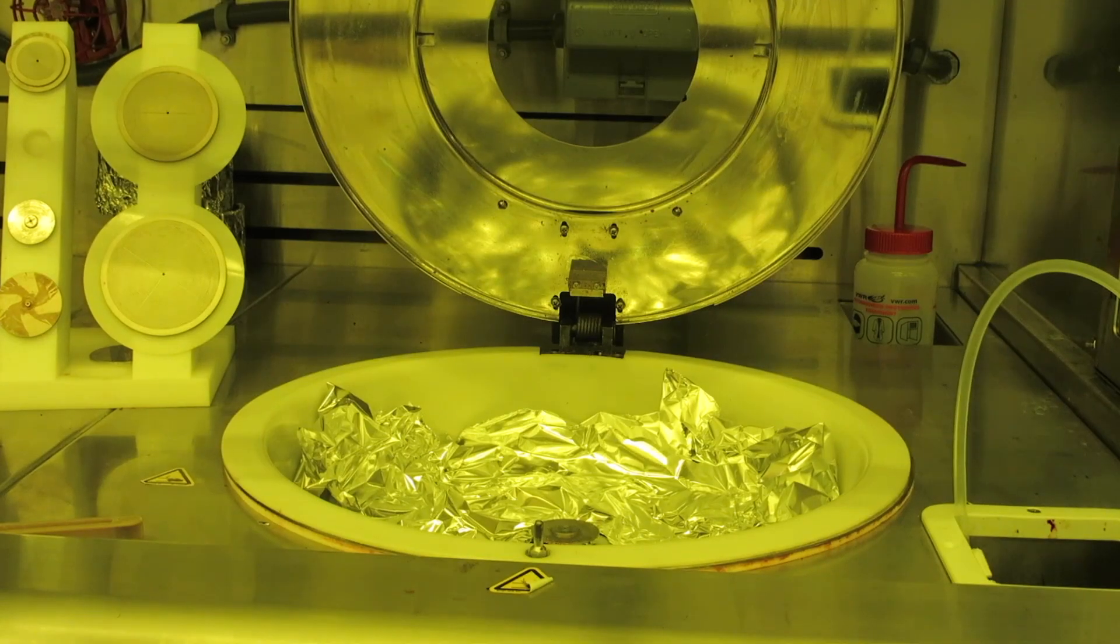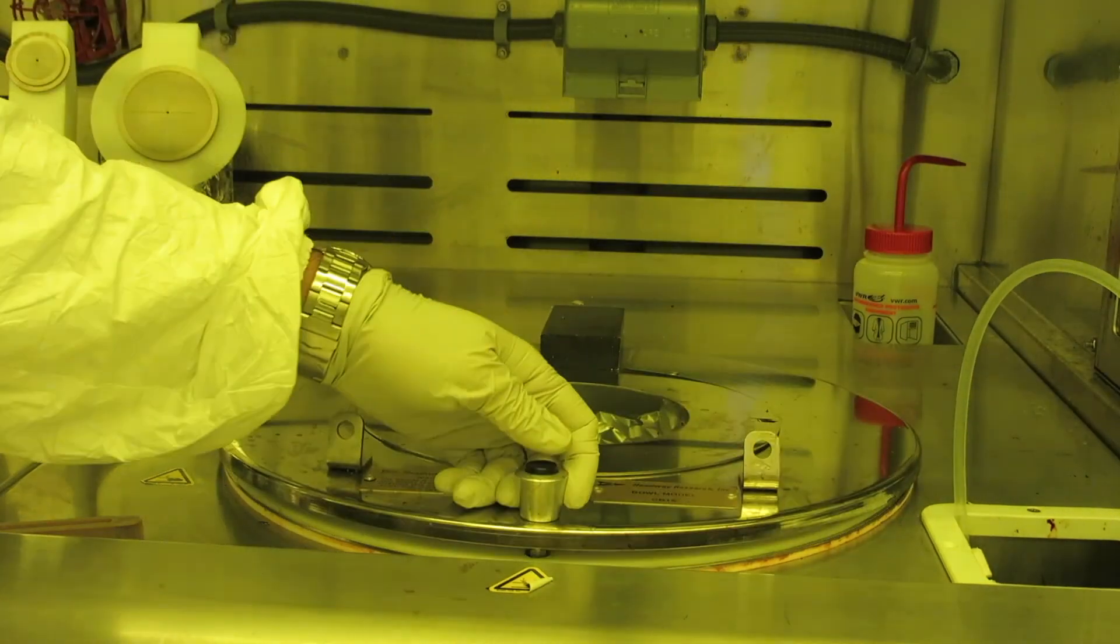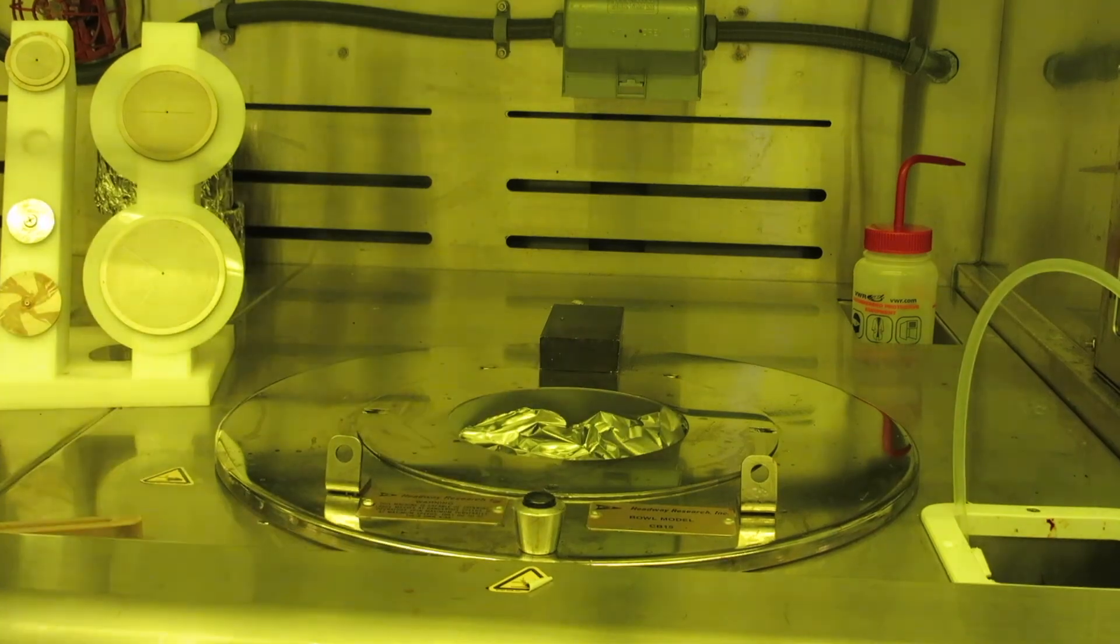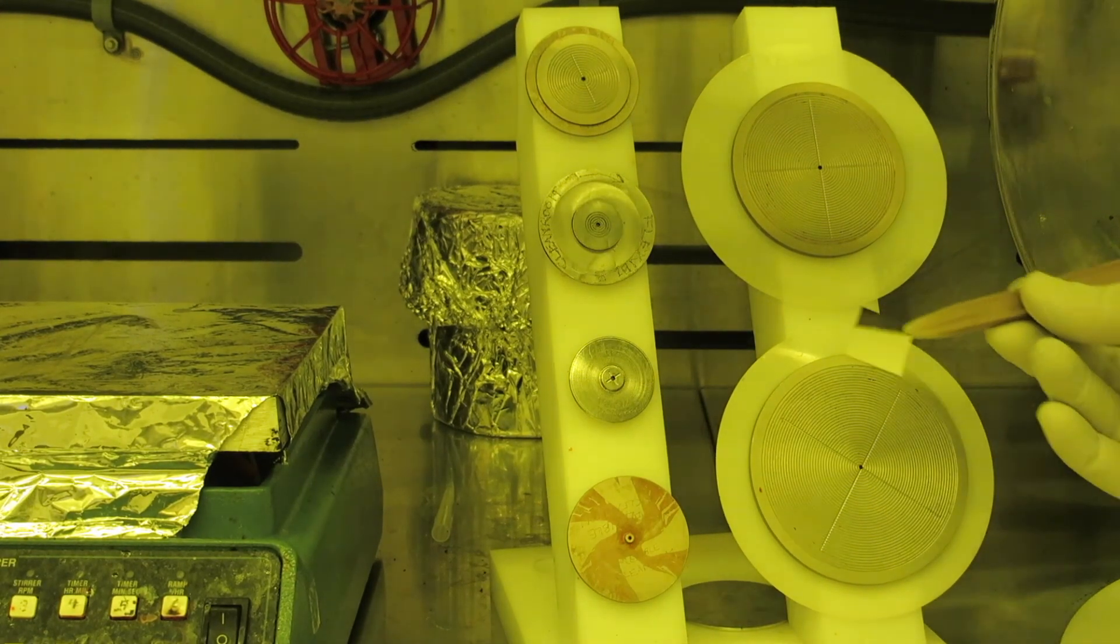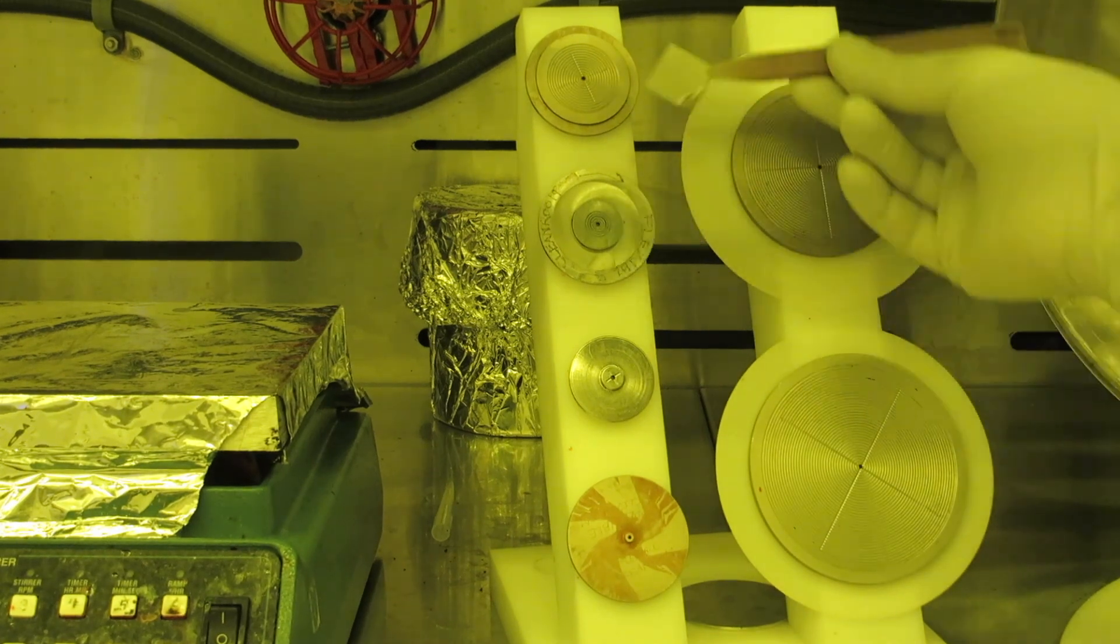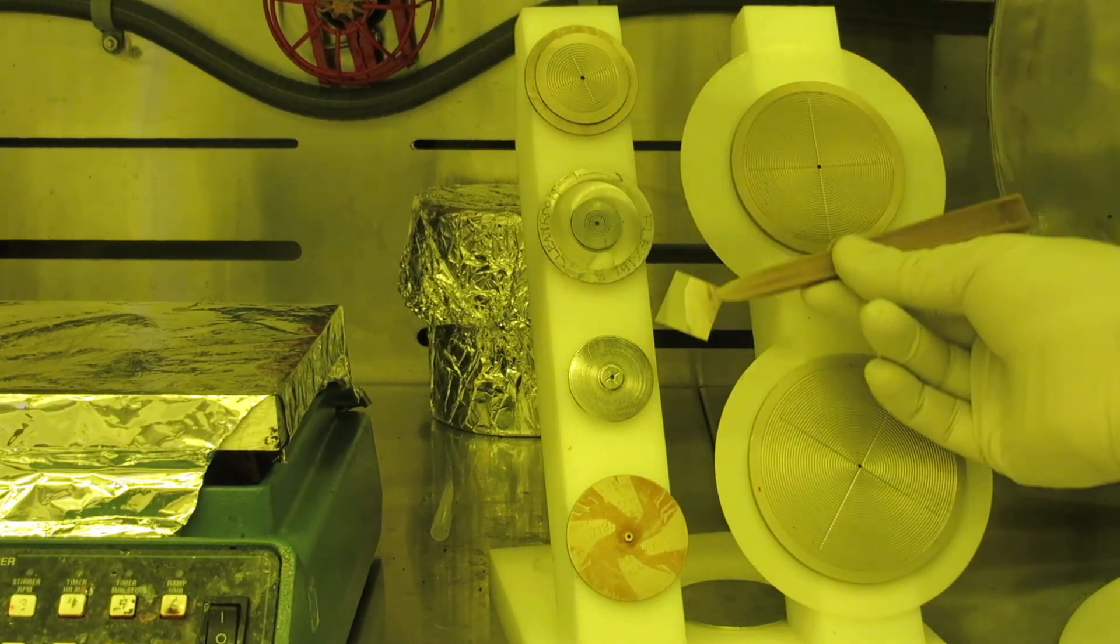To open or close the spinner door, press the little black push button in the knob. All of the chucks have a raised center portion with a vacuum scroll in it. You want your wafer or chip to completely cover the entire raised portion of the chuck.